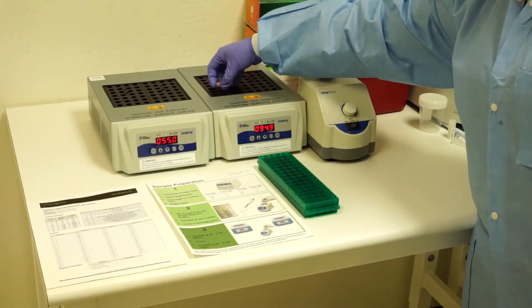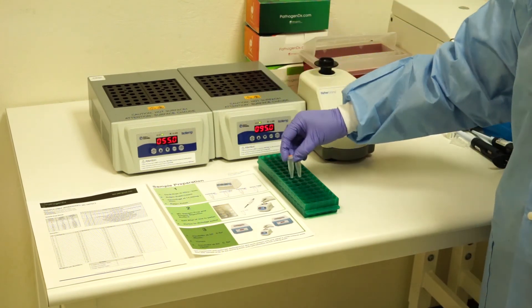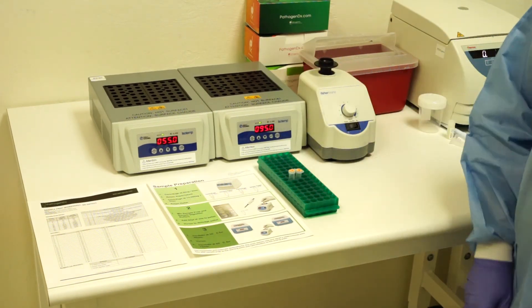Once the 15 minutes has elapsed, the samples may be removed from the heat and stored until PCR can be performed.